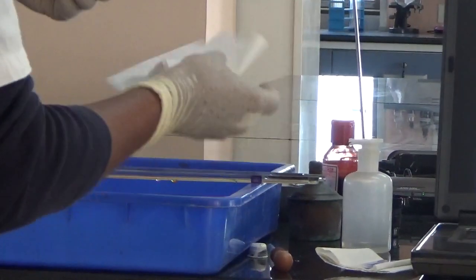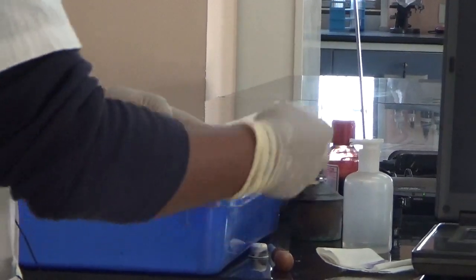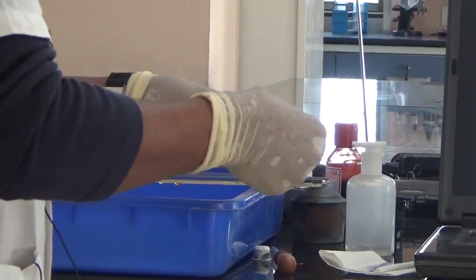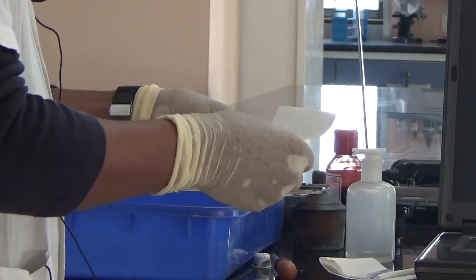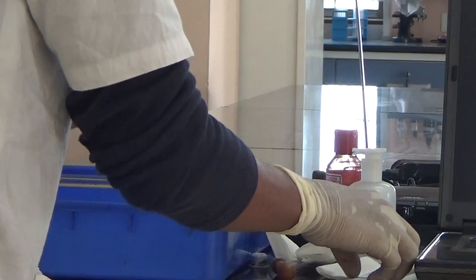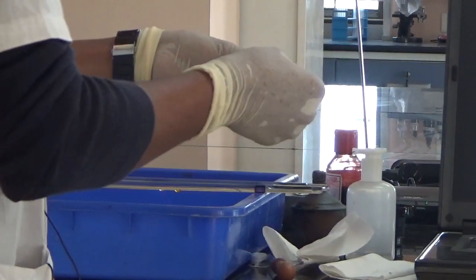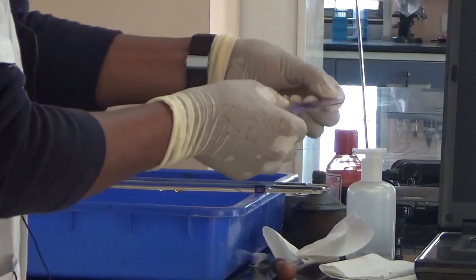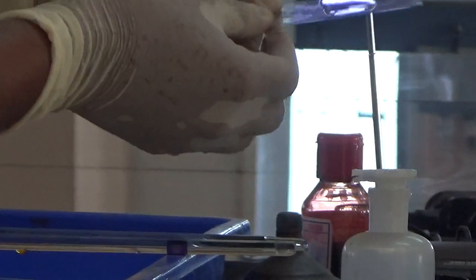Then dry it using the spirit lamp like this. After washing, apply immersion oil and prepare the slide like this to be viewed under the microscope.